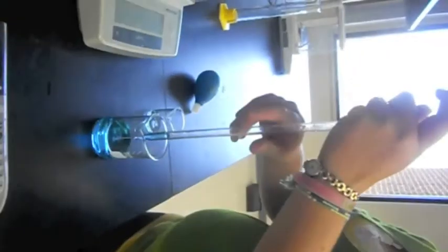Then you subtract these two totals to get your final volume, and that would be 1.73 milliliters. Let the rest of the water drain out back into the container.